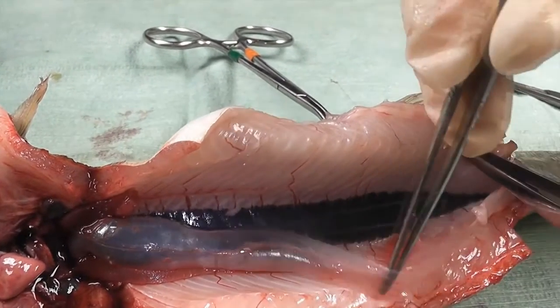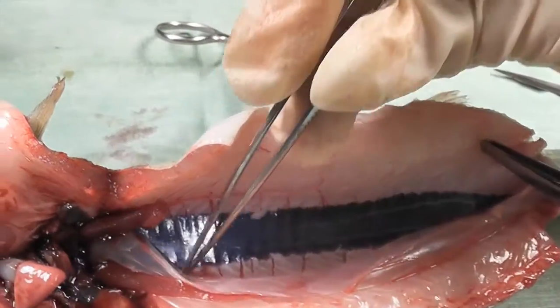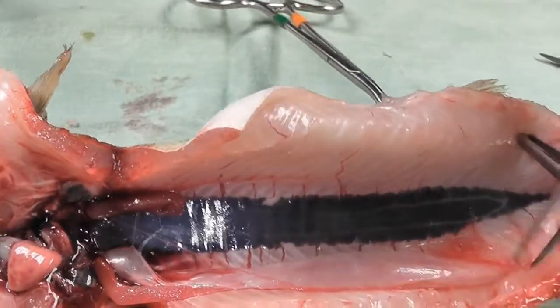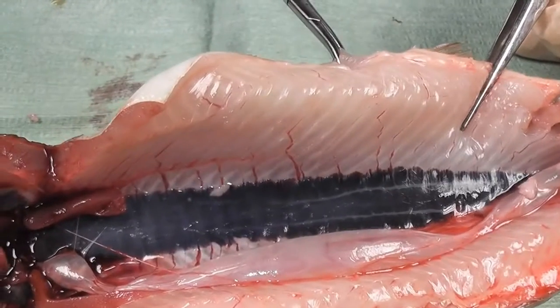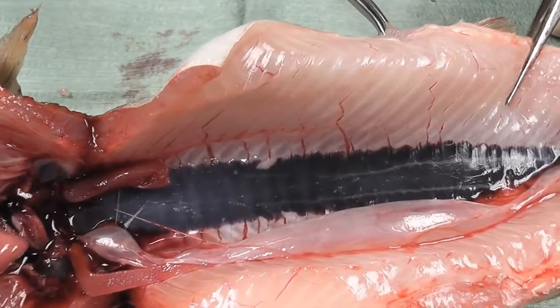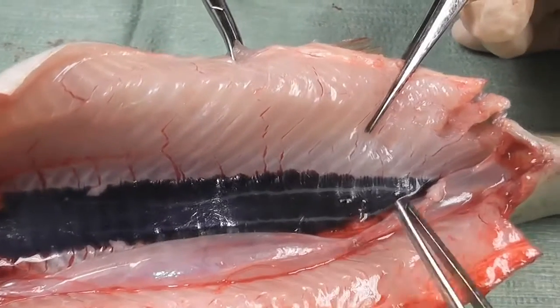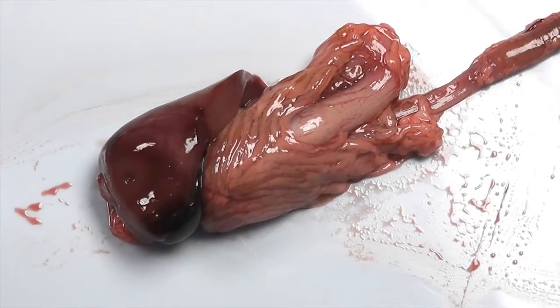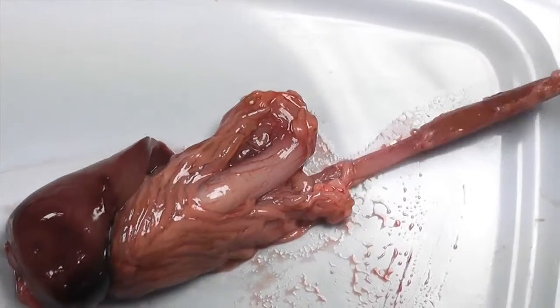We can show in detail the kidney. Now this is the gastrointestinal or digestive tract.